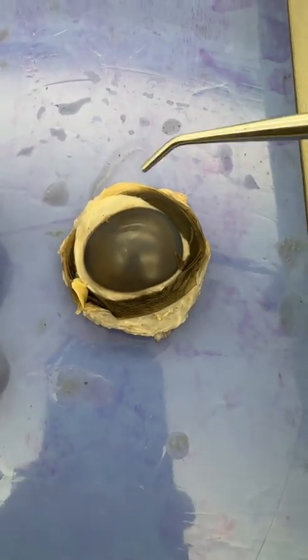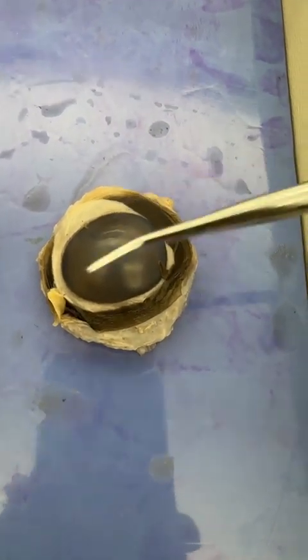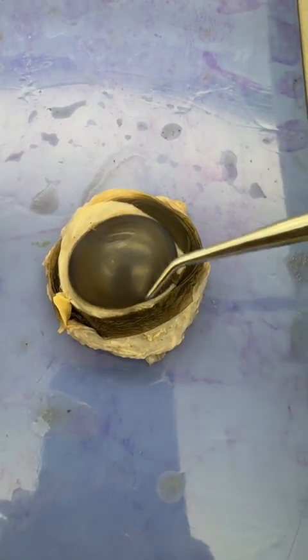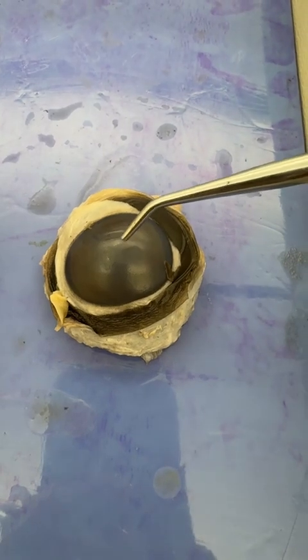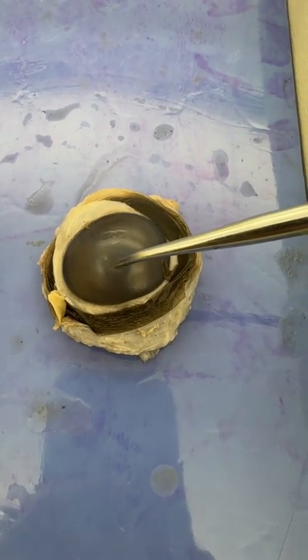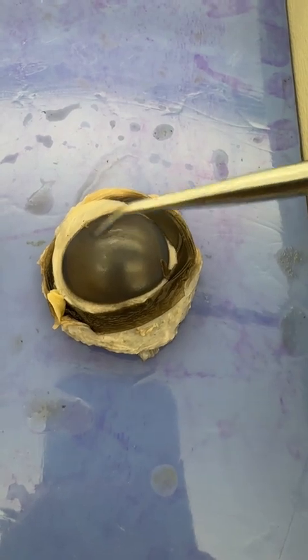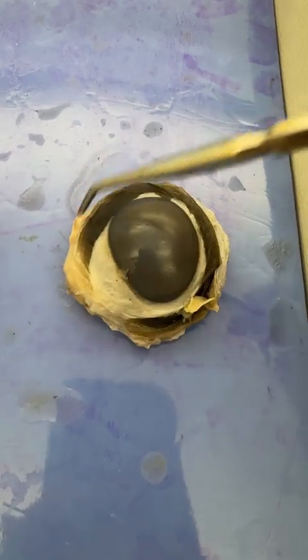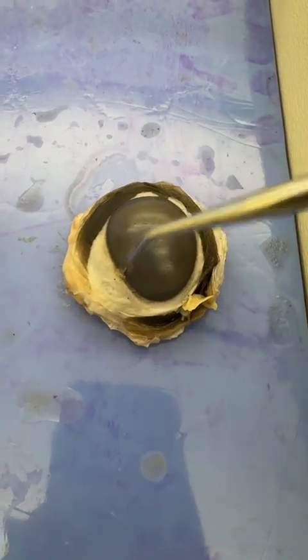Eye dissection time. All right, so this is a cow eye. This part right here, it does cloud up after death, but this would be the cornea. It is not solid, it's pretty squishy. Usually it'd be very clear on a living person, but it does cloud up after death.